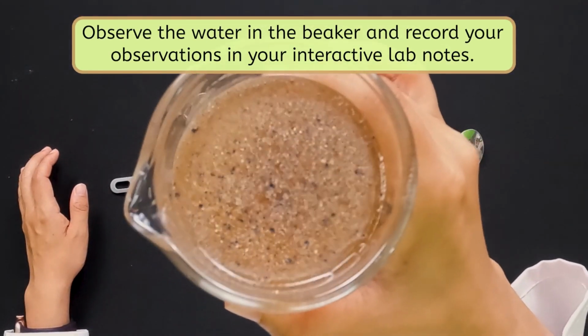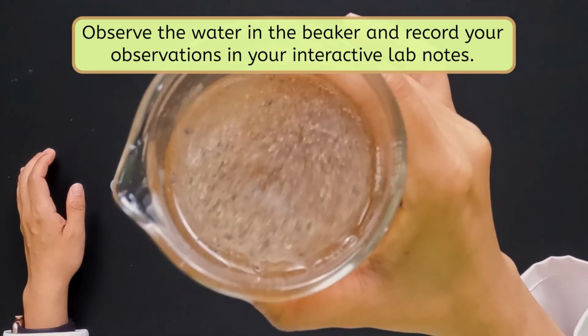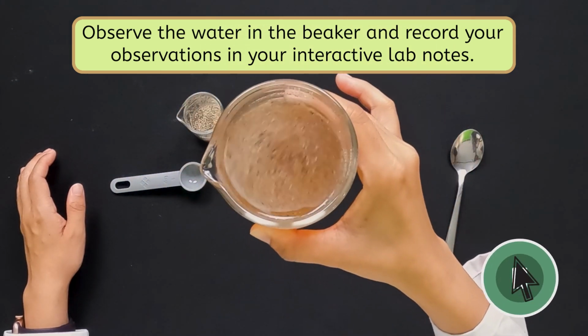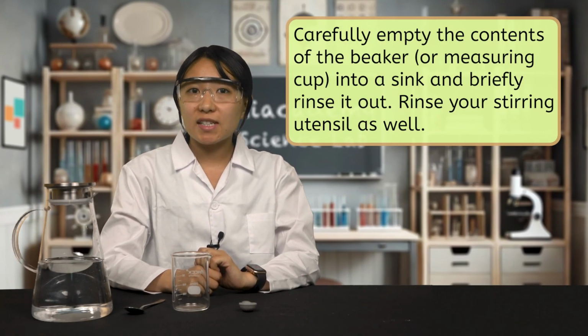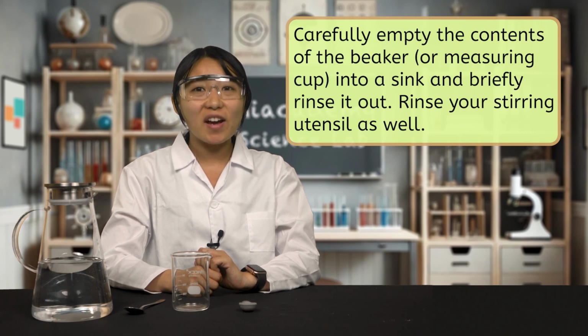Observe the water in the beaker. Did all of the pepper dissolve? Pause and record your observations in your interactive lab notes. Make sure to carefully empty the contents of the beaker into the sink and rinse the beaker and your stirring utensil before beginning the next trial.